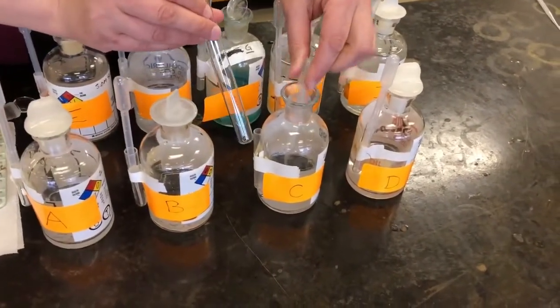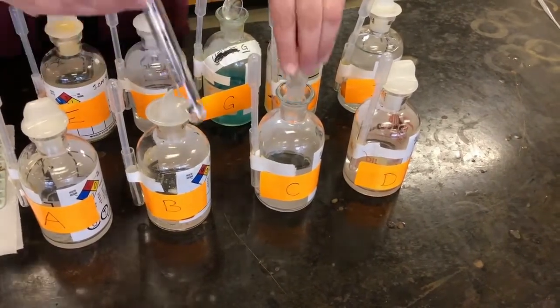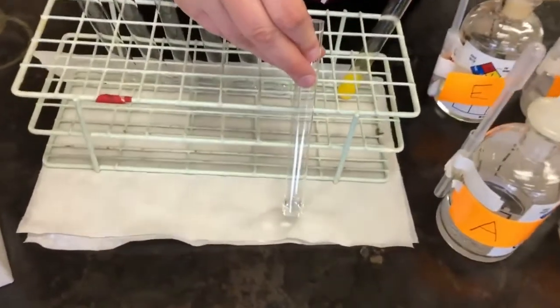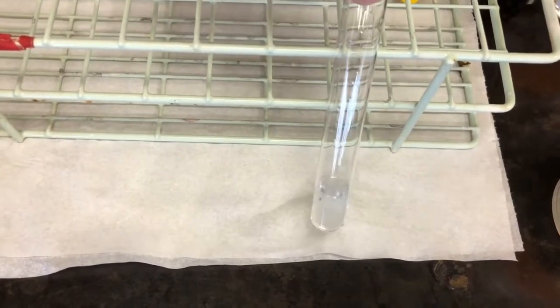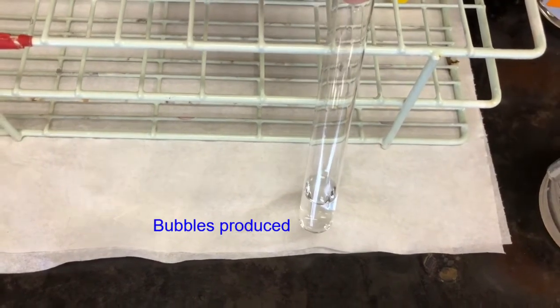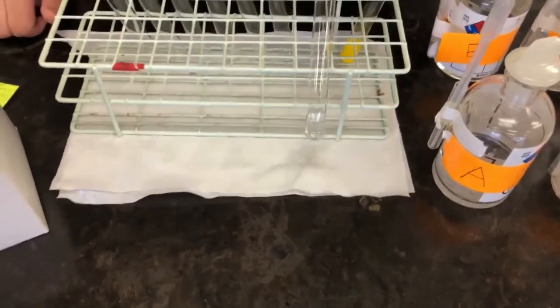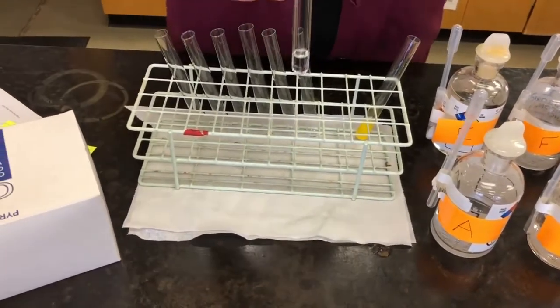Again, I'm going to take 1 ml of C, and 1 milliliter of D. This one you need to look really carefully because it happens pretty quickly. When I add it, you see that there are bubbles being produced. So our observation: formation of bubbles. What is our deduction based on that? C and D reacted to produce a gas. Now this one also asks us to smell, to see if there's an odor.